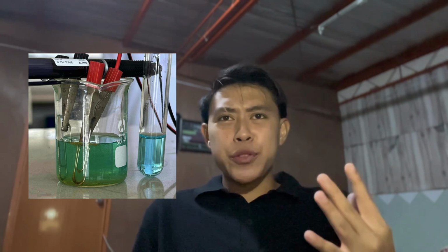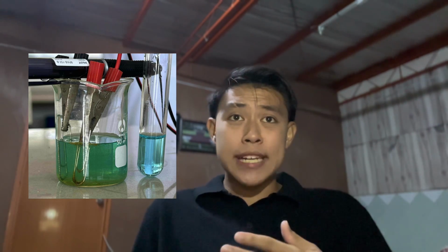Let's set it up. We inserted two iron paper clips on opposite sides of a 50 ml beaker, then connected a 9-volt battery using alligator clips. Our wastewater was dyed blue, so we set aside 1 ml as a reference and poured 25 ml into the beaker. And then you turn the power on. Exactly. Once powered, the anode began dissolving, releasing iron ions while the cathode produced hydrogen bubbles.